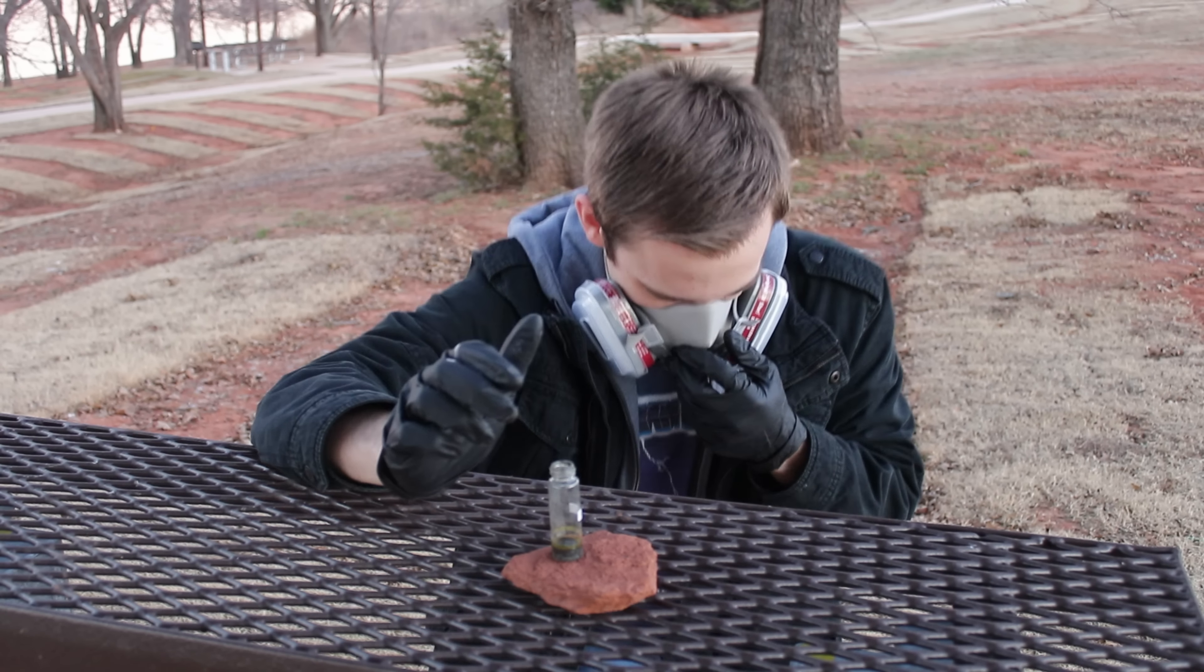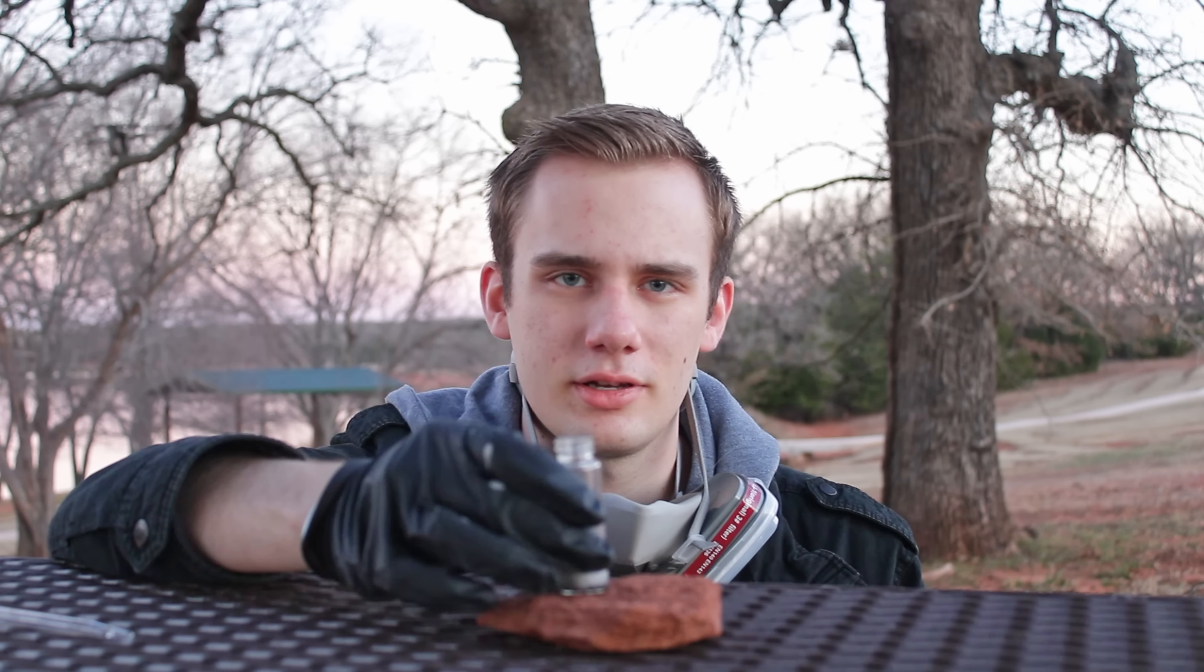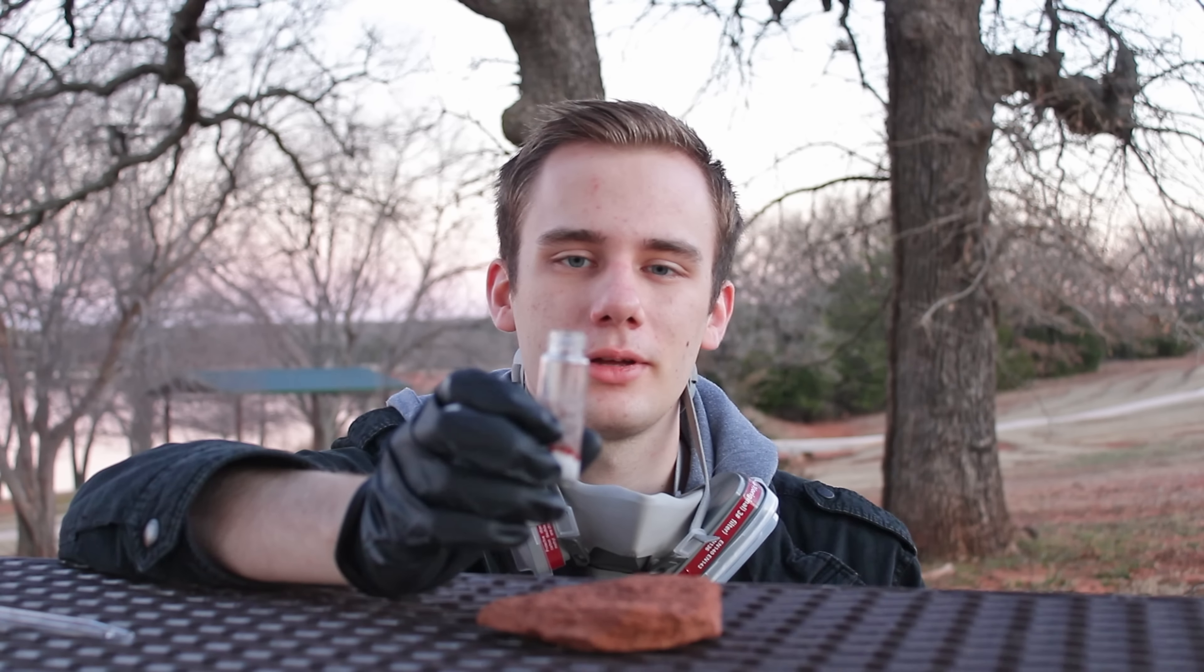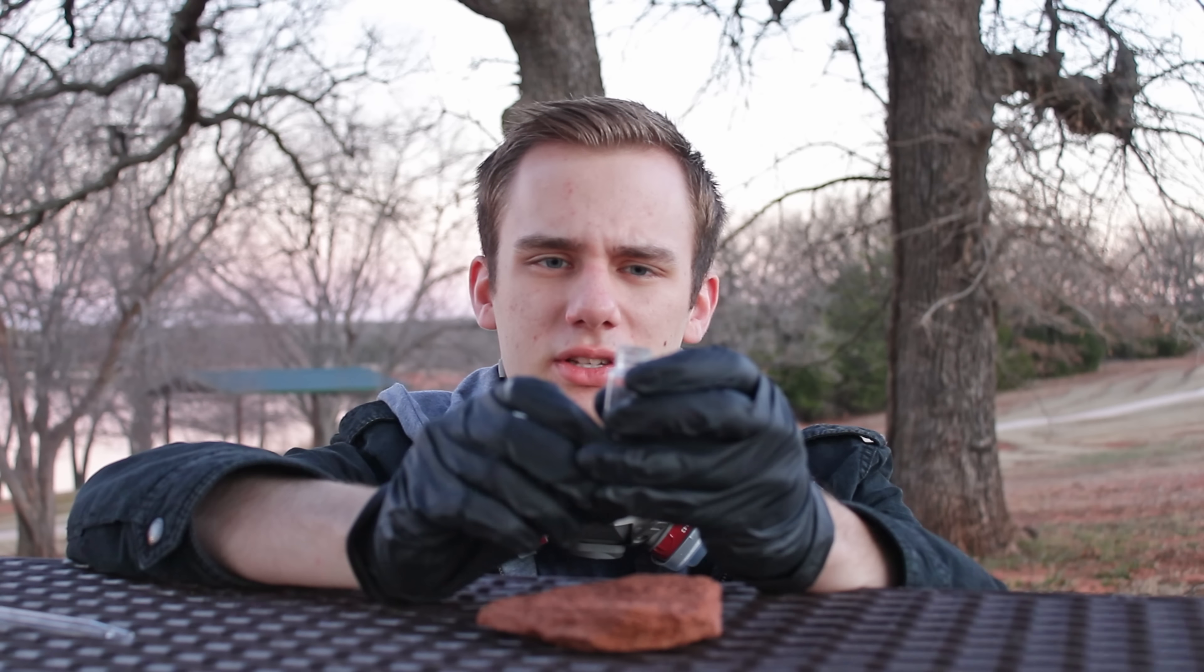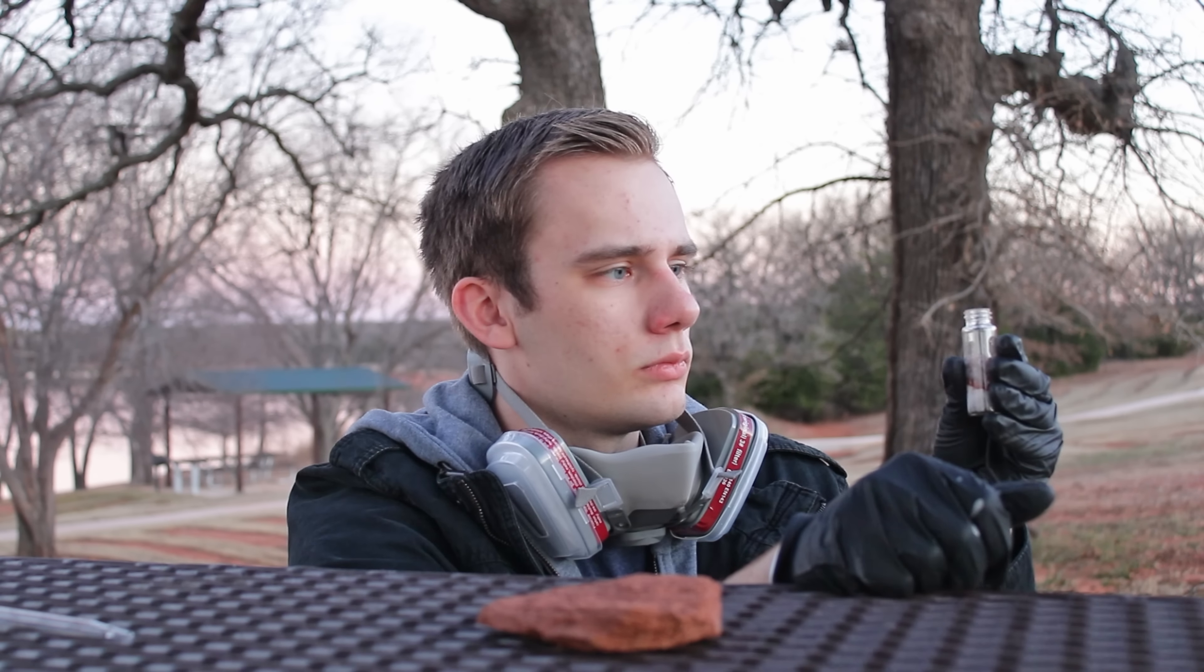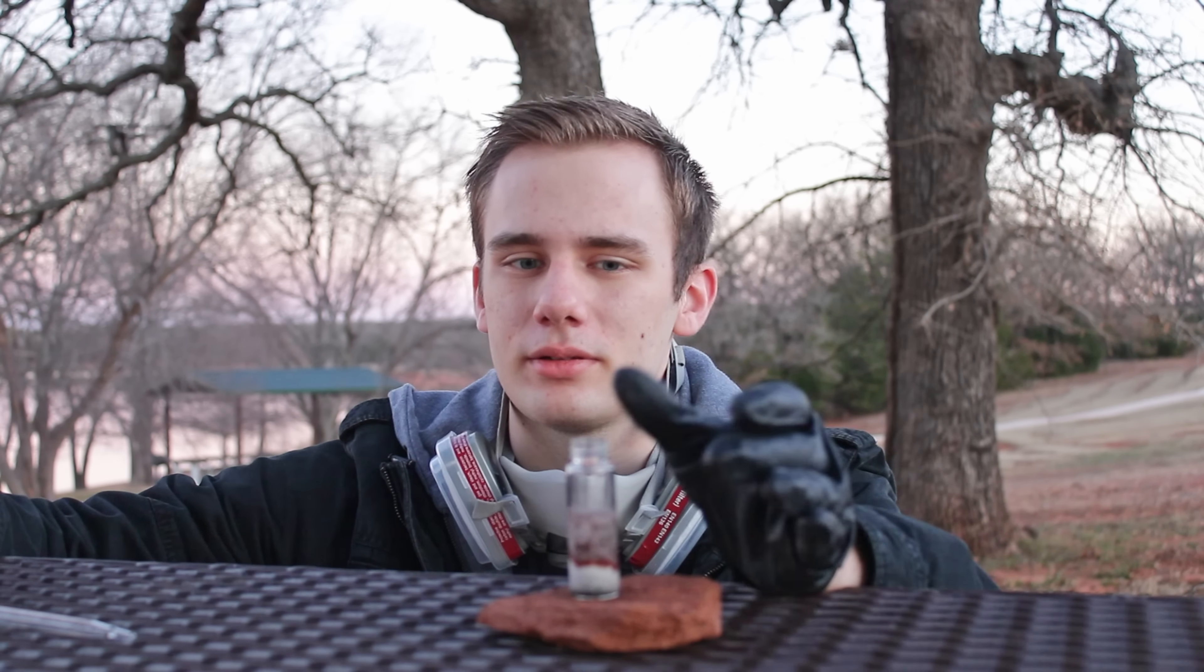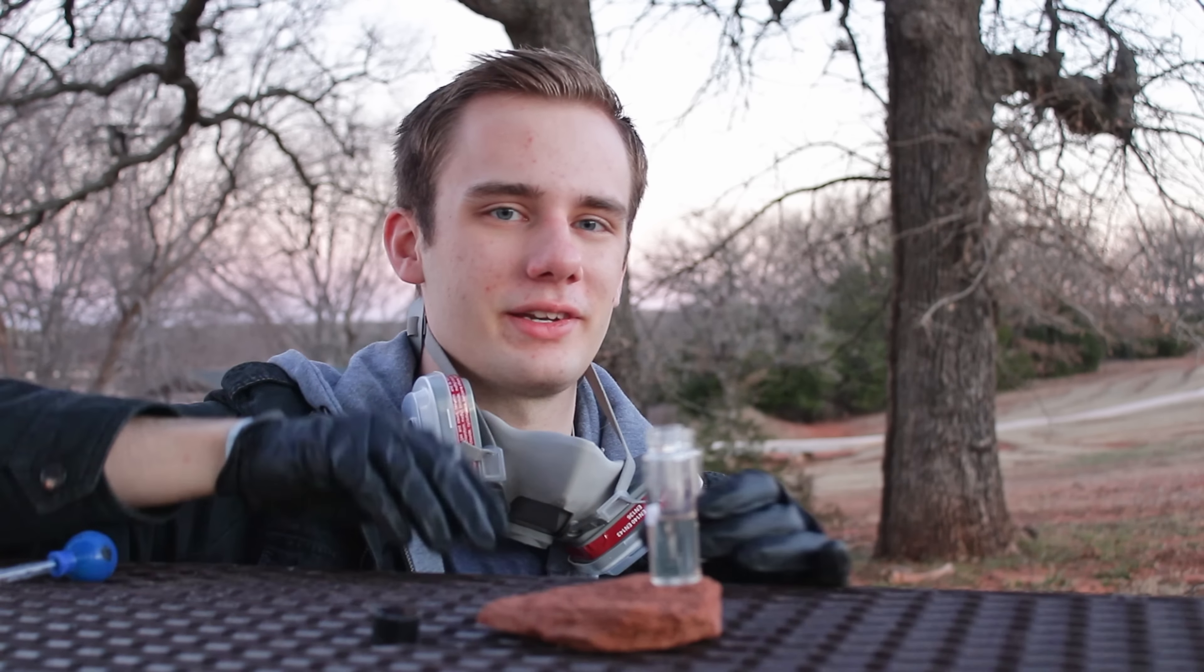I'm gonna get my mask on. This is the, in theory, isopropyl selenol, made from the isopropyl chloride that I made. And honestly, this one seems to have faded a little bit. Honestly, a lot of the isopropyl chloride evaporated as soon as it hit the hot solution. So there's probably not a lot of it in here.